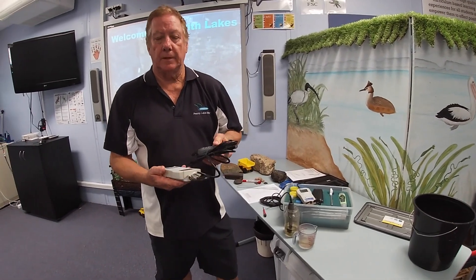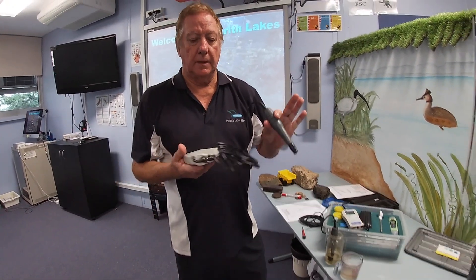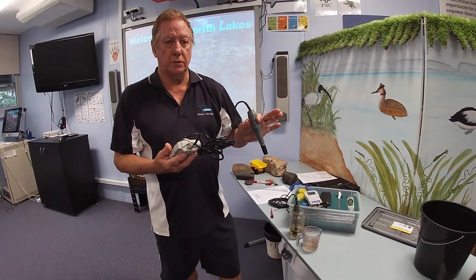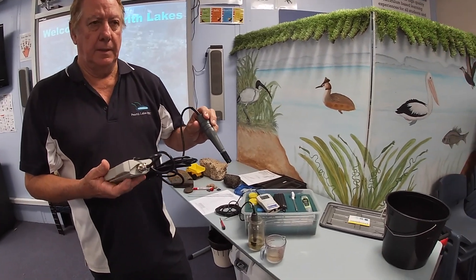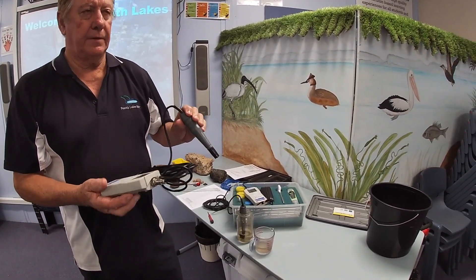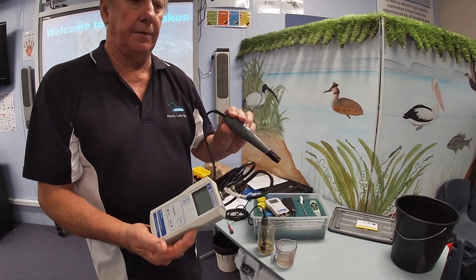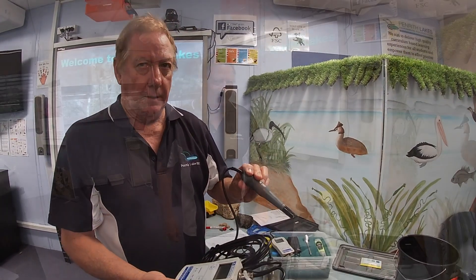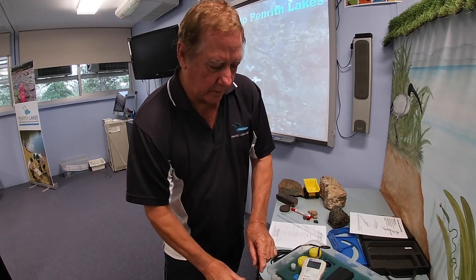It looks like this. This probe goes into the water and it records in milligrams per litre the amount of oxygen in the water. This is in the water but this is the actual device which records it. I've got a separate one here for demonstration purposes. We'll have a look at the probe that's in the water and then look at our oxygen meter to see how many milligrams per litre of oxygen is in that water.